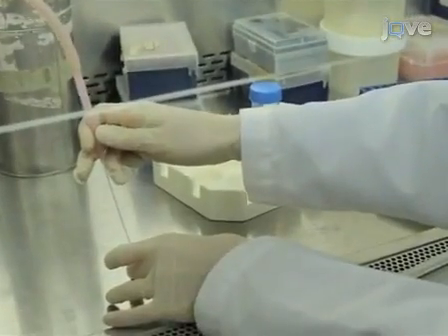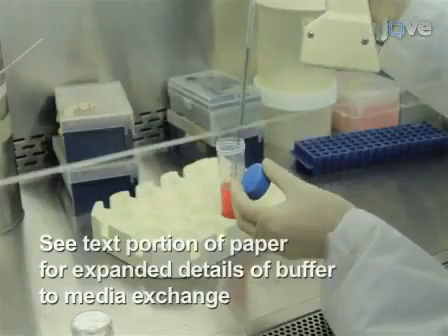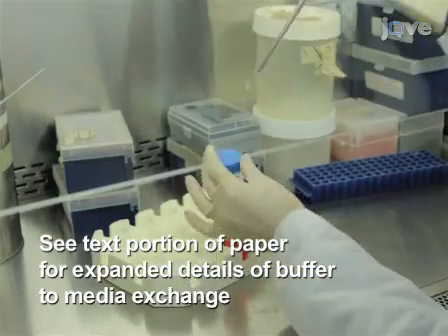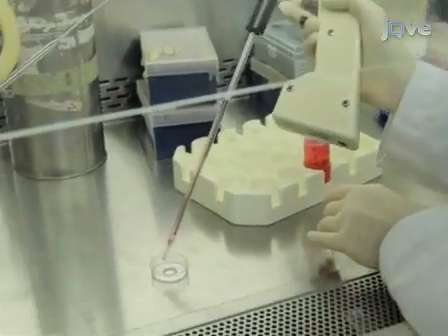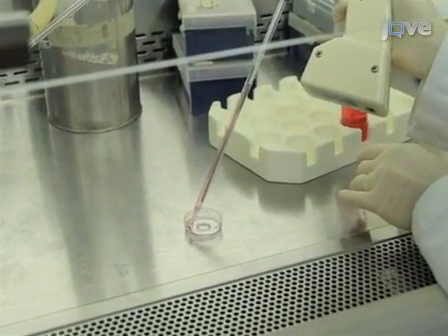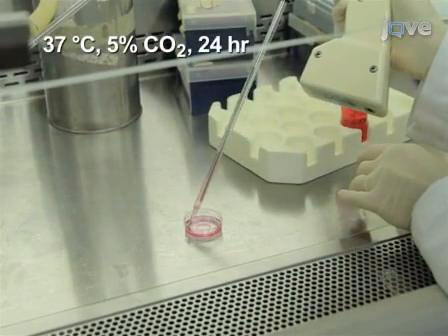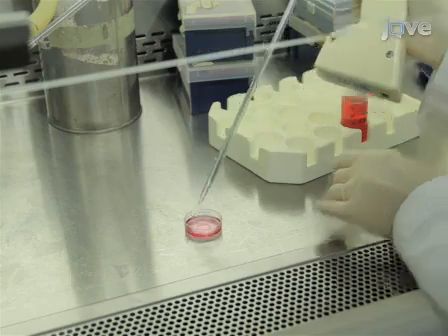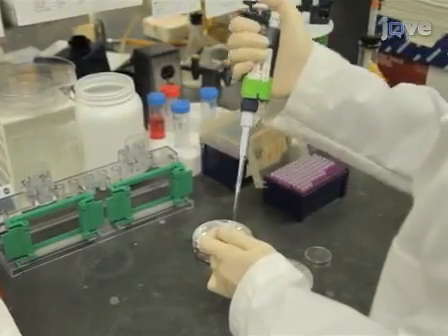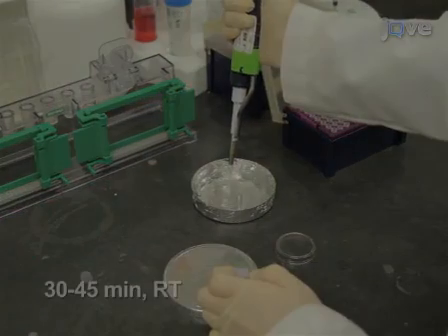After the cells have adhered to the bottom of the chambers, gradually change the buffer to M199 medium supplemented with FBS, streptomycin and gentamicin, and then incubate the chambers at 37 degrees Celsius in 5% carbon dioxide for 24 hours. After the incubation, stain the cells with the desired calcium indicator for 30 to 45 minutes.